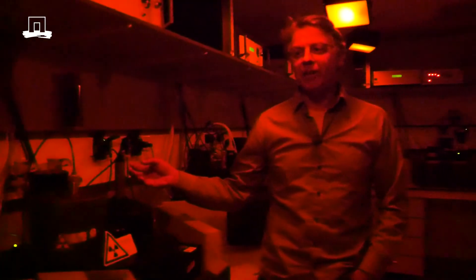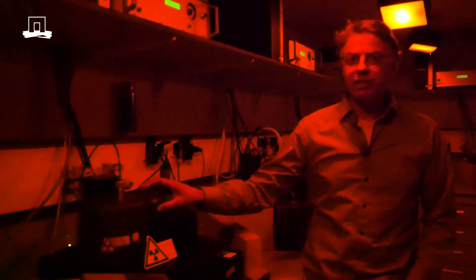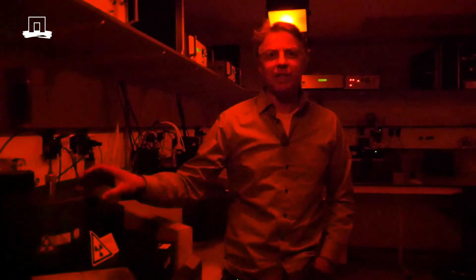With this machine we measure the Luminescence signal. It has a very light-sensitive detector which measures the Luminescence signal from the grains, and it allows us to charge the signal using a beta source — a radioactive source. It does in one second what happens in nature in 100 years.